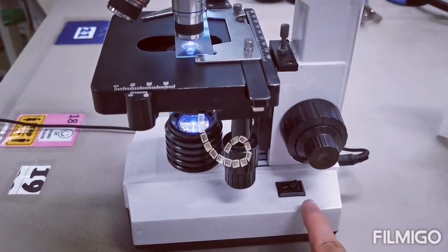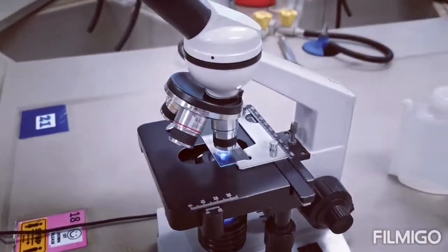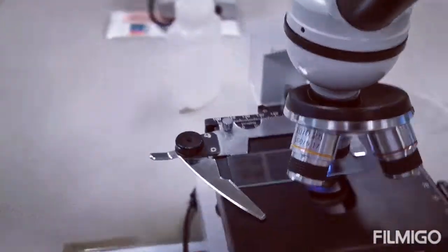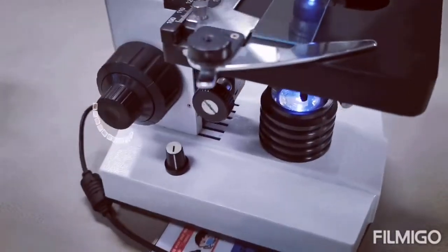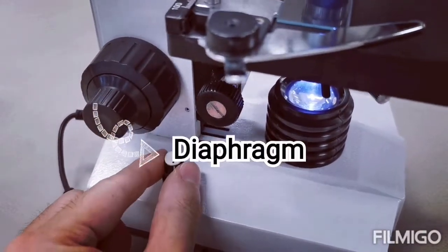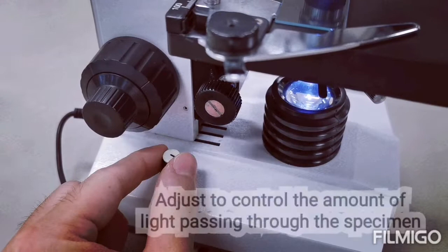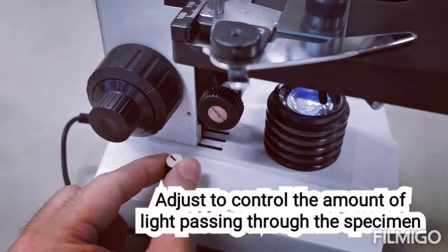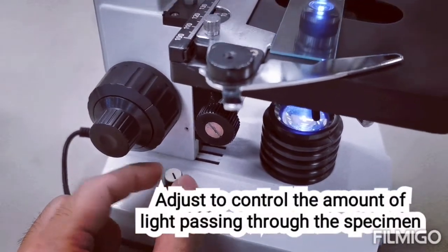And of course, we have the power on and power off button. Moving to the other side, over here we have what we call the diaphragm, which can be adjusted in order to control the amount of light that is coming from the light source. So this is used to adjust the brightness.